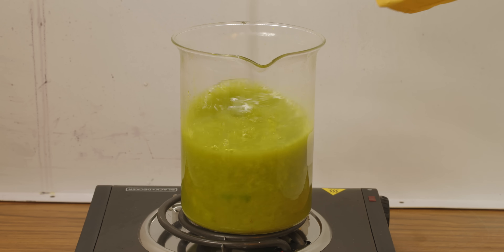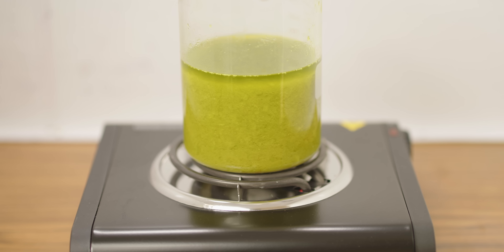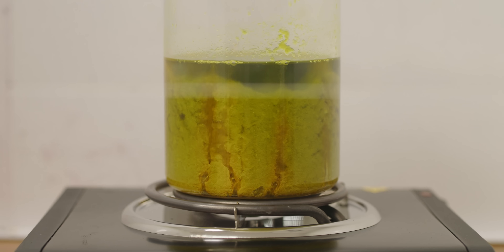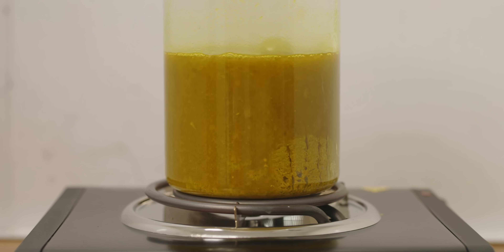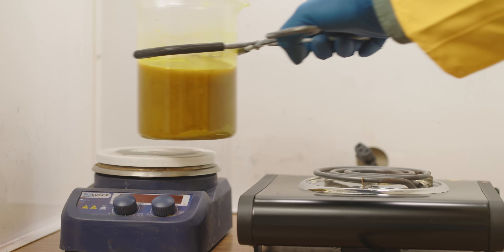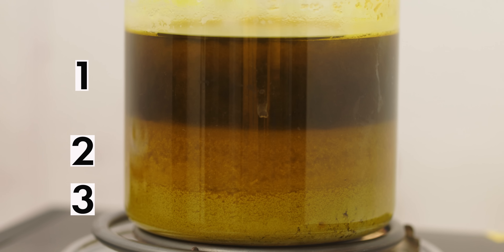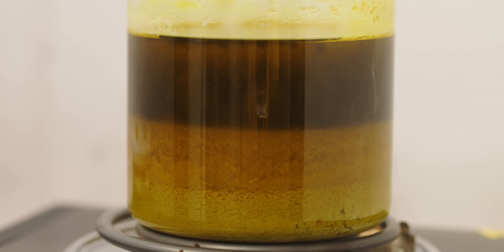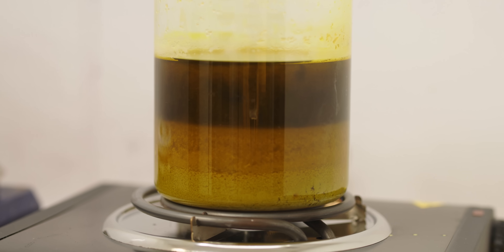I'm tempted as it's starting to look like another drink we should not taste — a forbidden smoothie, perhaps. I turn on a little heat to help the paper along. You can see the silver chloride start to settle at the bottom of the beaker. After a few minutes I take it off the heat and allow everything to settle. You can see three distinct layers in the beaker, which I can only assume is the silver chloride on bottom, the paper in the middle, and the hydrochloric acid on top.